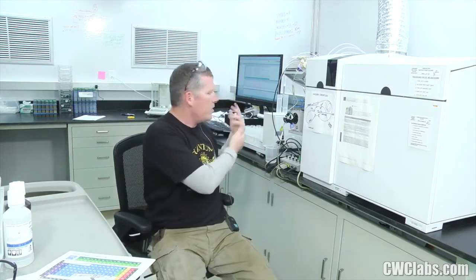A lot of people tend to blame the instrument right away, but the instrument is not lying to you. There's something that you are doing, or maybe something's wrong with your calibration standards. Maybe you have pipette carryover from one to the other. Maybe you have done something wrong in your calculations of concentrations. Who knows? All kinds of problems that could come up.